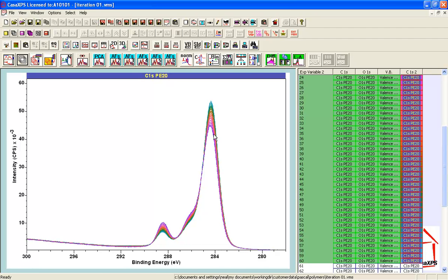So in principle I can apply different spectra to these data, and I should be able to calculate from these data at least two good significant spectral shapes, component spectra, that I ought to be able to fit back to the original data. And if I'm going to be able to fit this back to the original data, I need to have something that looks like PMMA that derives from these data.